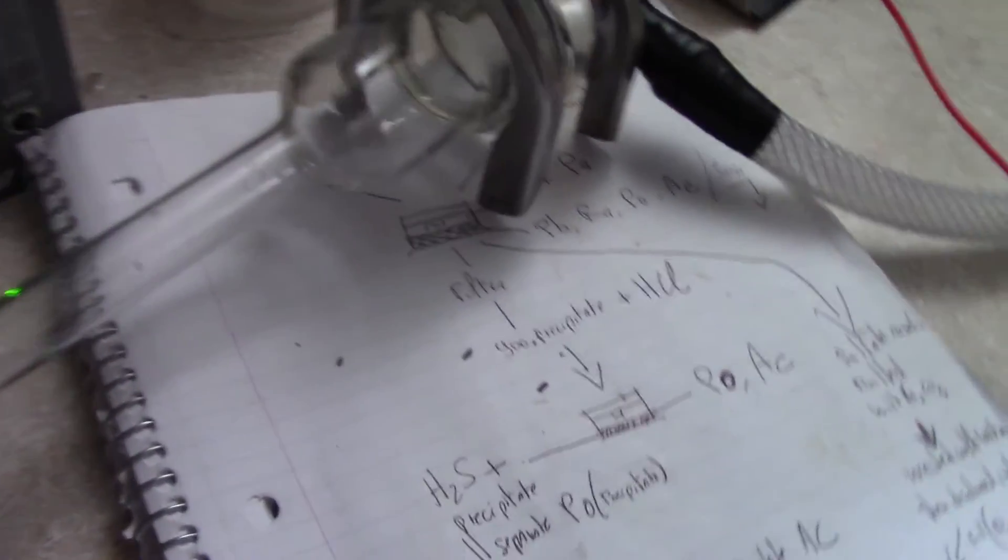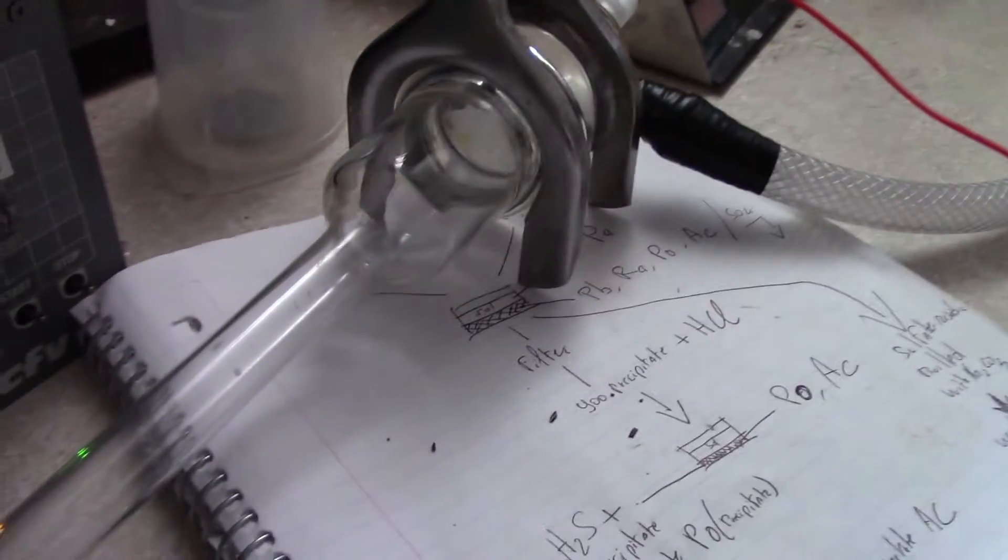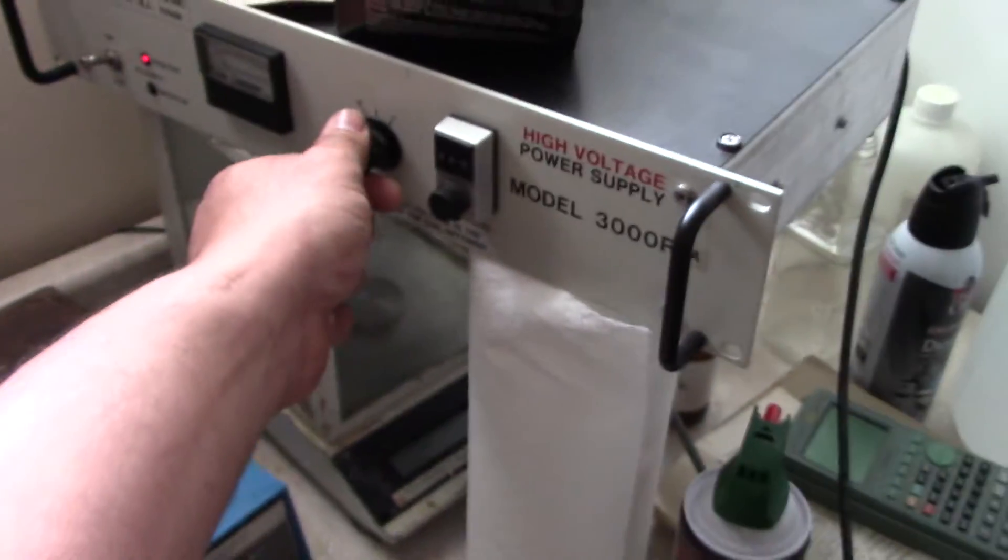That's the focusing ring and to the target we'll have a phosphor. It's difficult to see. But we'll also set up a couple thousand volts of accelerating voltage.